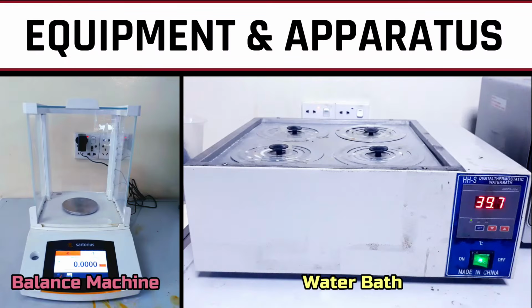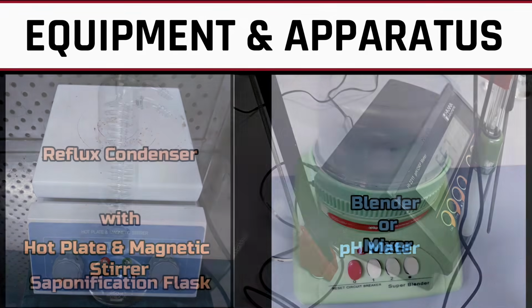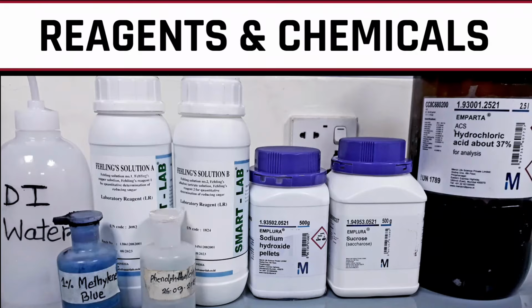To conduct this procedure, we need a balance machine, water bath, hot plate, pH meter, reflux condenser with saponification flask, blender or mixer, measuring cylinder, volumetric flask, conical flask, funnel, pipette with filler, filter paper, distilled water, hydrochloric acid, sodium hydroxide pellets and other reagents and apparatus needed to determine the total sugar by the Lane-Eynon method.